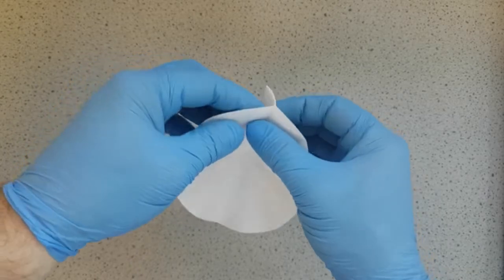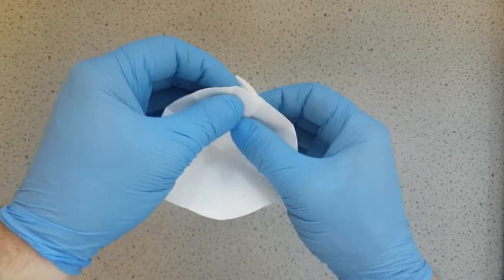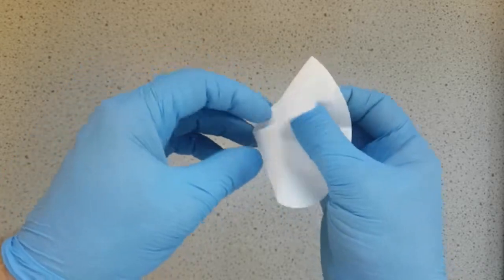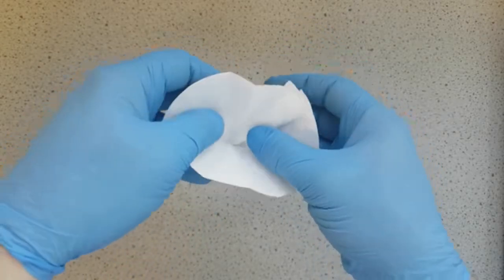So next, just concertina our folds together, the best you can. Making sure that our folds are nice and crisp.